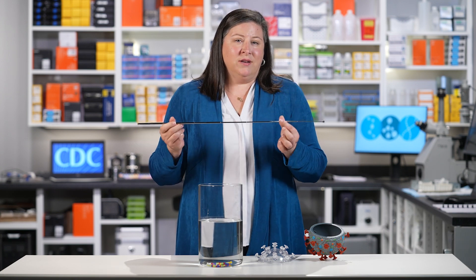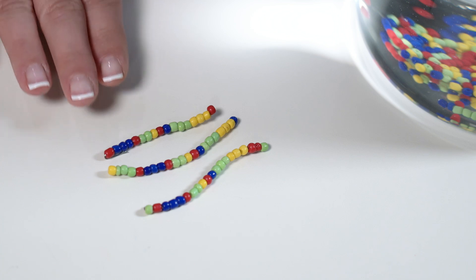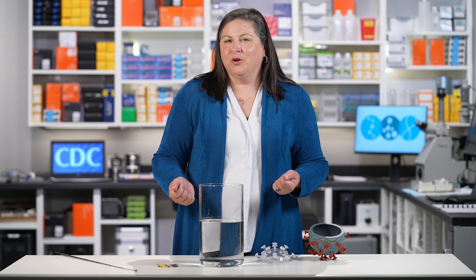So let's imagine this wand is a sequencer. It's going to sift through all of the things in this sample to pull out just a tiny piece of RNA that we're targeting to help us identify COVID-19. See how these line up? These targeted sequences match up with our gene of interest. With these data, we can answer questions about what infections are circulating in the community right now and if specific mutations are present. By repeating this sequencing across many samples, we can understand how long the infections have been in the community and if they're increasing or decreasing.